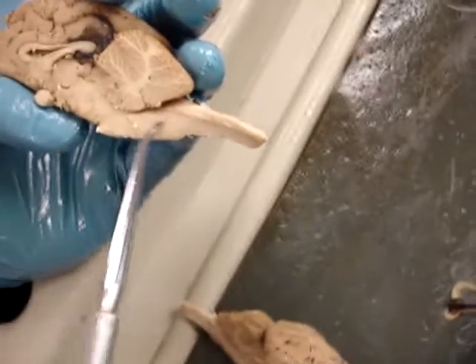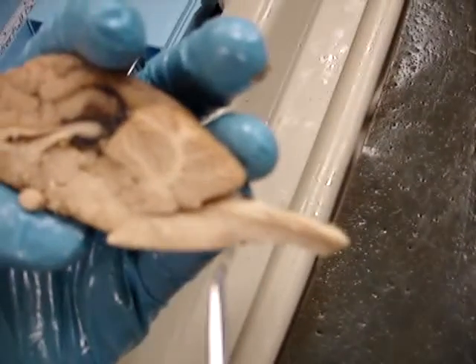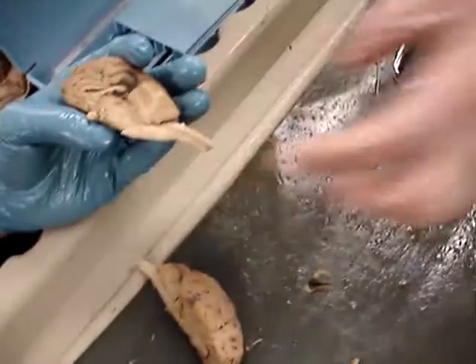You only have to know the spinal cord and the fact that the aqueduct goes down right here, but it's not really dug out on this specimen.